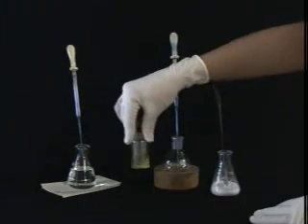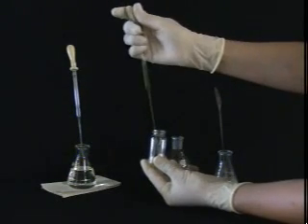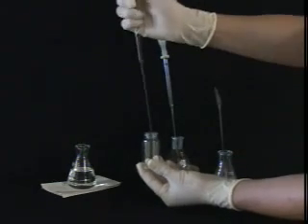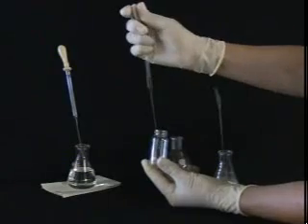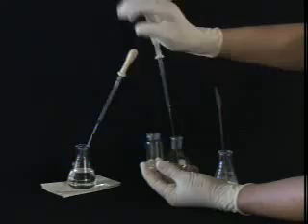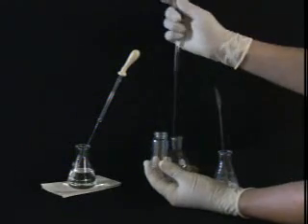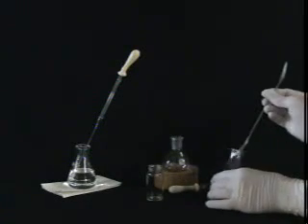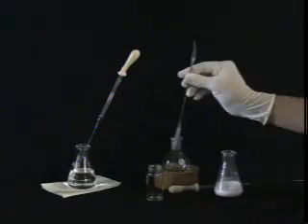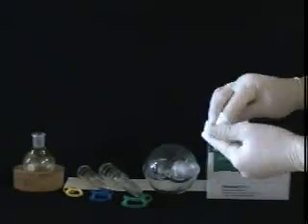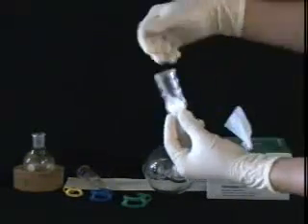Start by dissolving your sample in methylene chloride and transferring it to the round-bottom flask. Make sure you complete the transfer with a few rinses. Then, add a small amount of silica gel to the flask and swirl to mix. Before you can remove the solvent on the Rotovap, stuff a few kim wipes into the bump trap to prevent contamination of the Rotovap with the very fine silica powder.